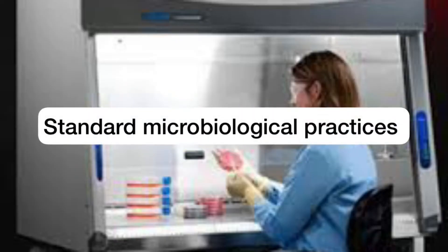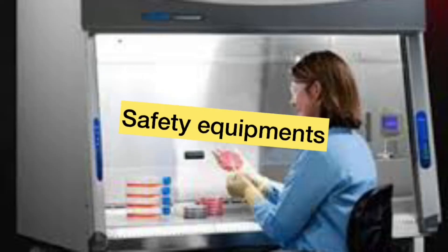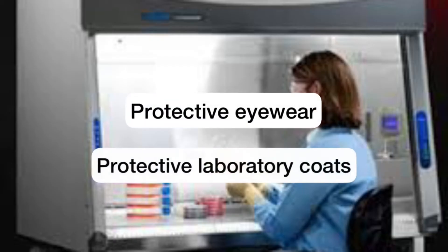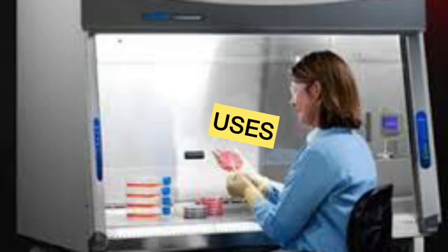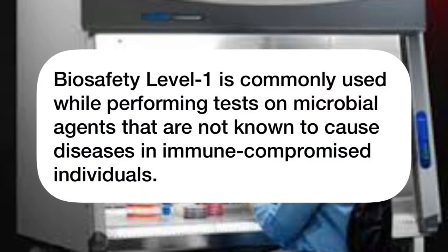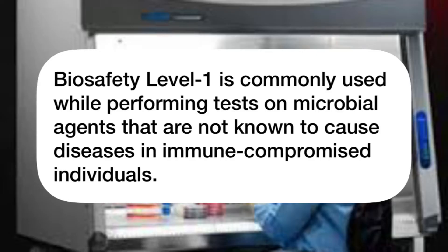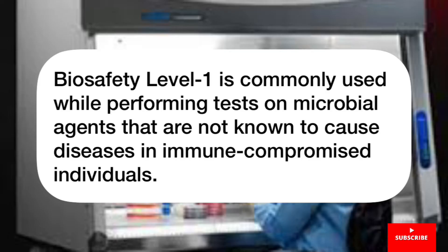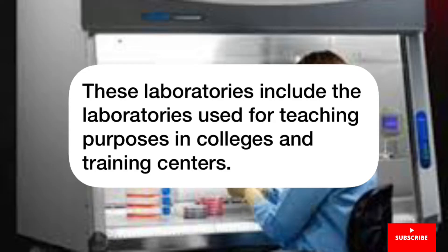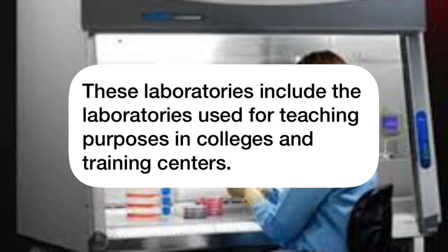For safety practices, standard microbiological practices are required. The safety equipment required includes protective eyewear and protective lab coats. Biosafety Level 1 is commonly used while performing tests on microbial agents that are not known to cause diseases in immunocompromised individuals. These laboratories include the laboratories used for teaching purposes in colleges and training centers.